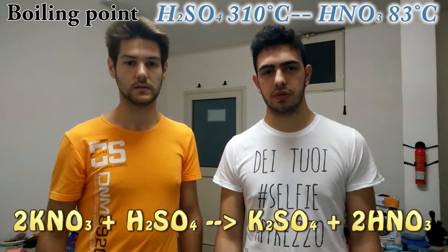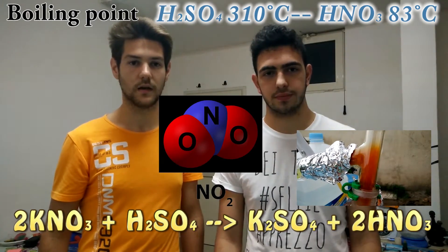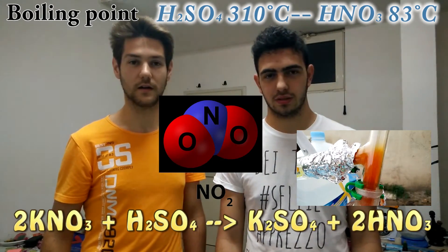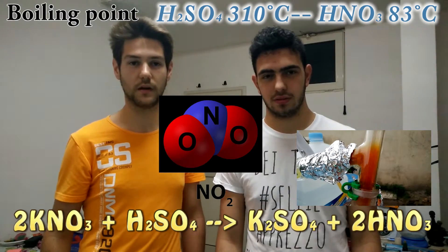It also produces a gas which is nitrogen dioxide. Some precautions that we have to take are to cover all the exits of the distillation apparatus in order to prevent this gas from coming out, because it is very toxic.